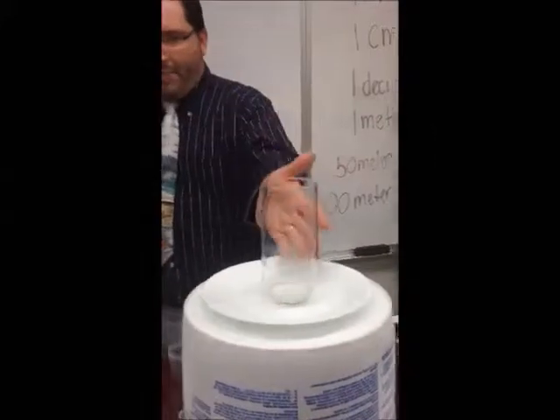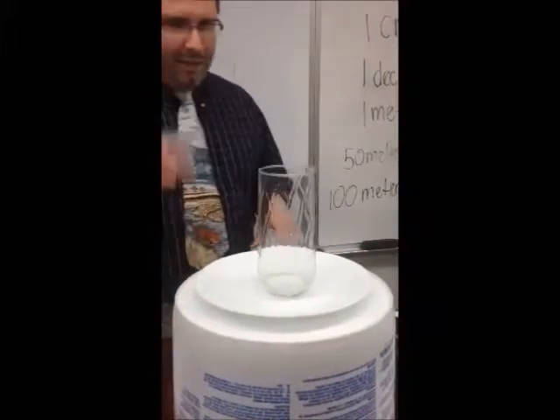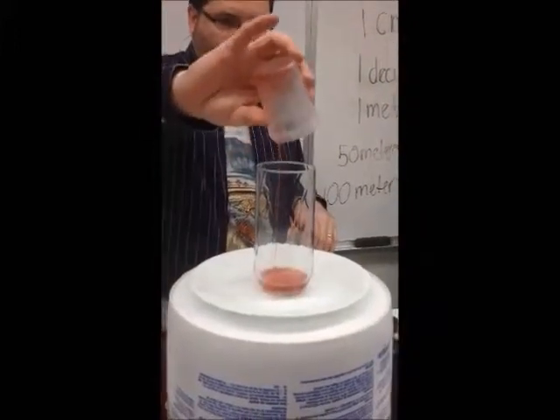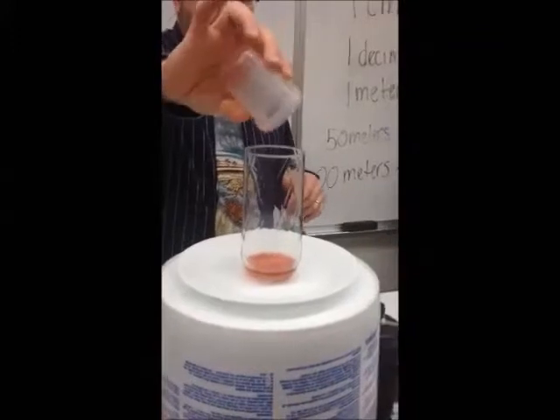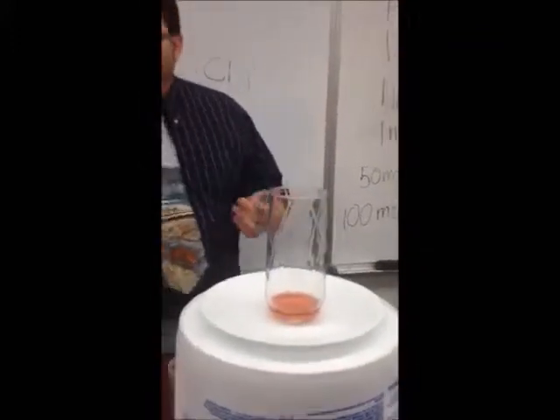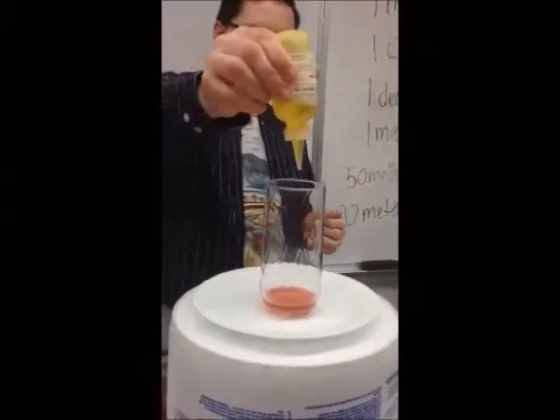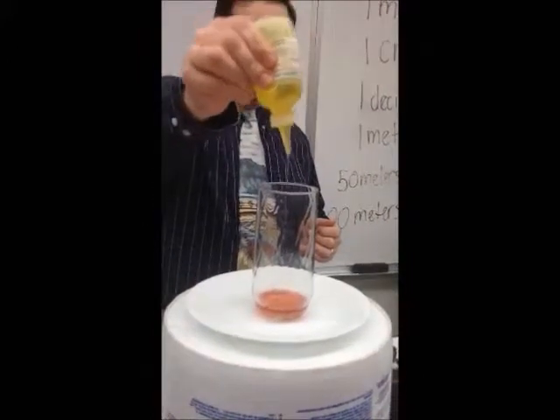So we have the hydrogen peroxide concentrated 30%. Okay, we're going to add a little bit of the soapy water. Why is it yellow? Because I put a drop of food coloring in just so you can see a better effect. We're going to add a little bit more soap solution. This is just like stuff you wash dishes with. Okay, a little bit more.